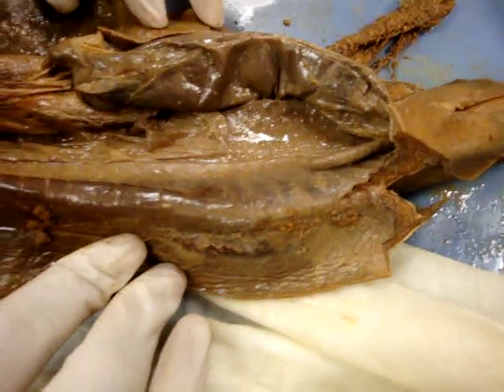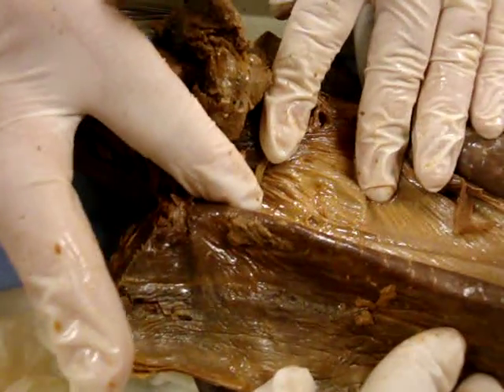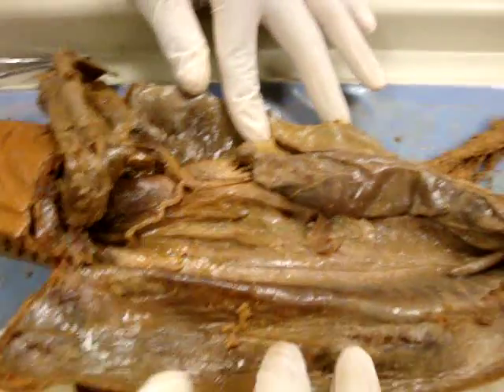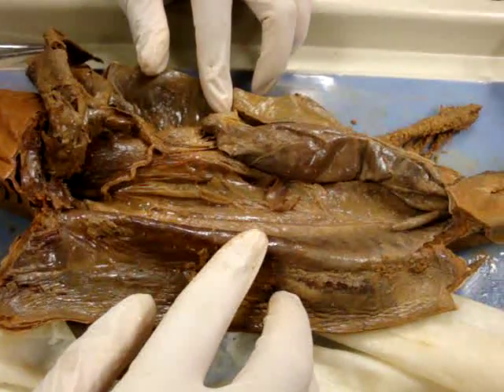As I mentioned before, this is a female shark. The ovaries are found right up here. This is obviously an underdeveloped ovary — oftentimes you'll find eggs inside it, but this is a young one. So there's an ovary there, kept very deep inside the shark and very well protected.